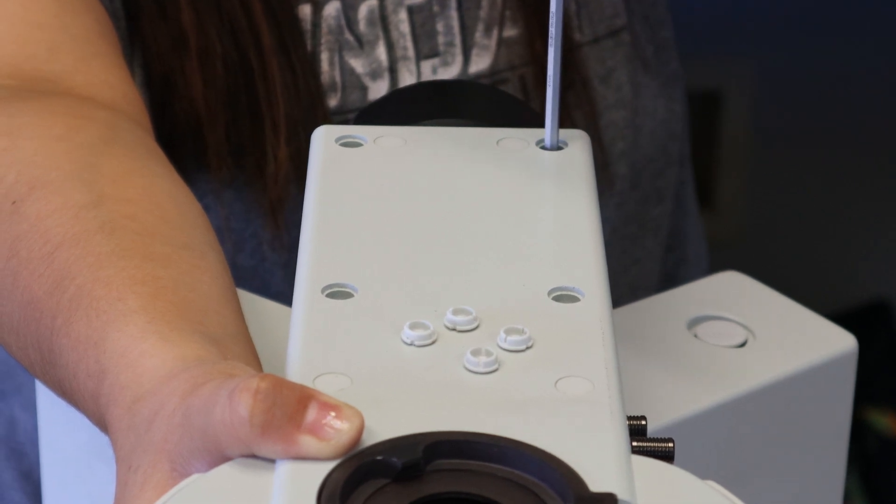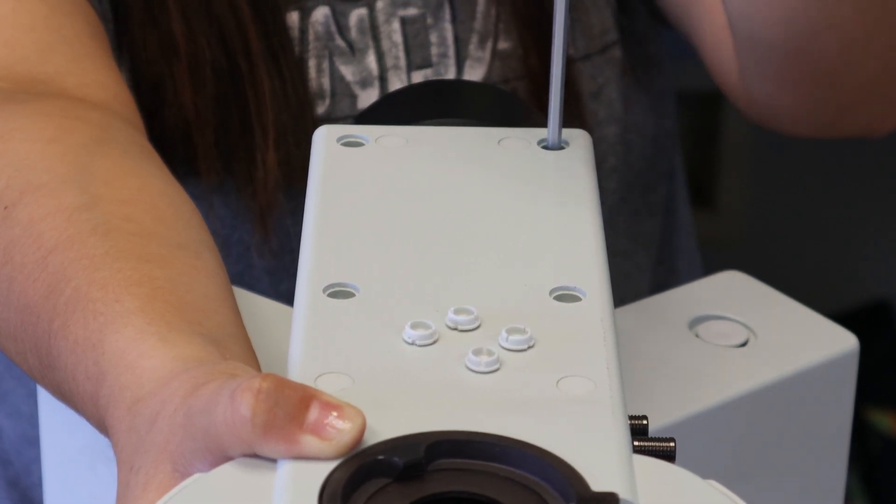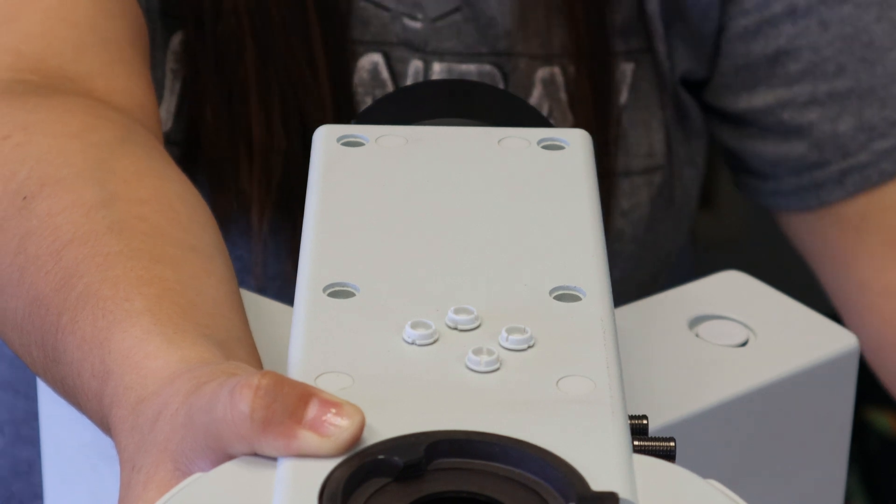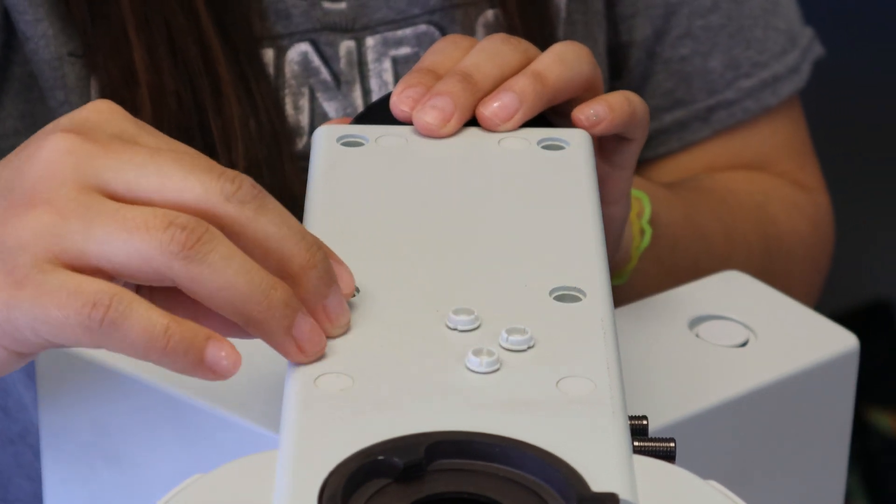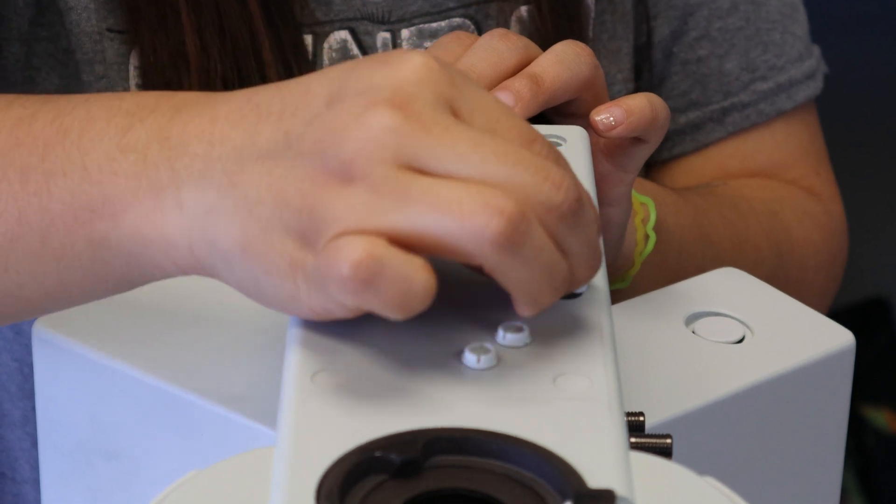Okay, you see Maria's got them all tightened up. Now we're going to go ahead and move on to the next portion. We're going to have her go ahead and replace the caps on the top of the stand so that those bolt holes are covered.